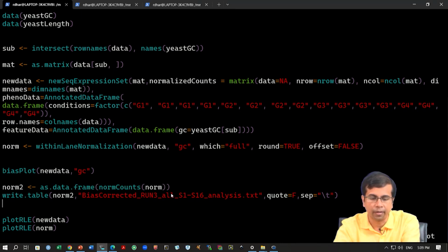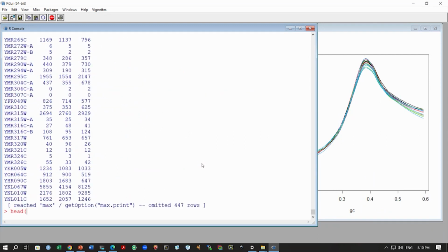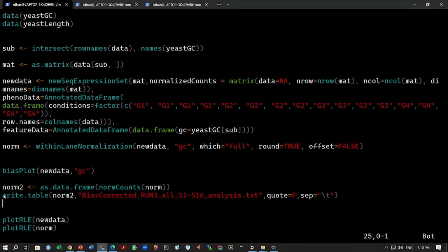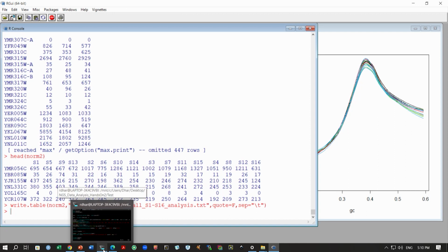We will get this normalized count data, and we can check it a little bit. Maybe we can try head norm2, and you will see this is different from what we have seen earlier. From the raw count data, this is actually different. You can compare, and it should be different because this is corrected for the GC content bias. Once we have generated this data, we can simply write this table using the write.table command, and this bias corrected file will now be generated. We can verify this through the command line. We will have a look at that in a moment.